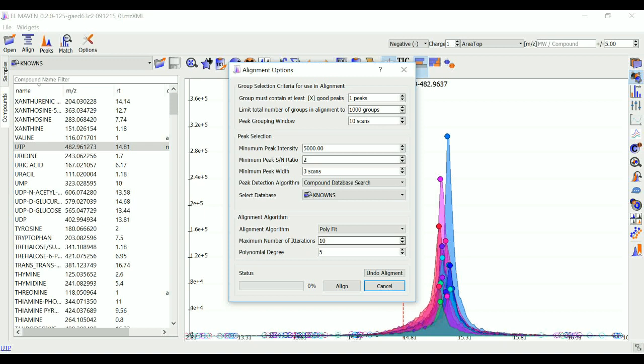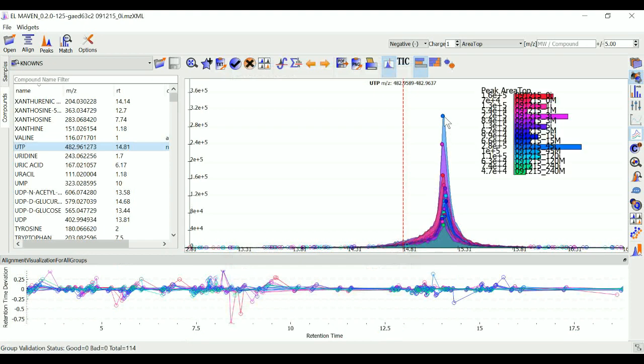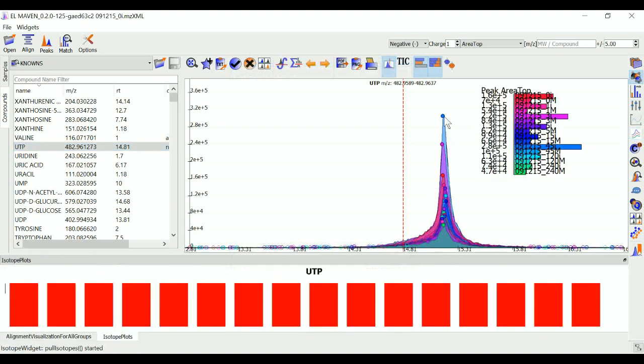Polynomial degree is the degree of the non-linear model we are trying to fit. Recommended settings are entered by default. After setting these, you can just click on Align at the bottom. As you can see, the peaks in this group are much better aligned than before.